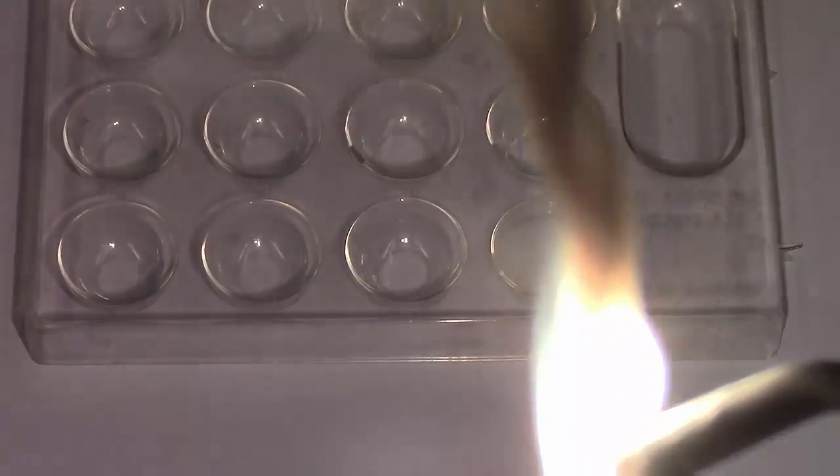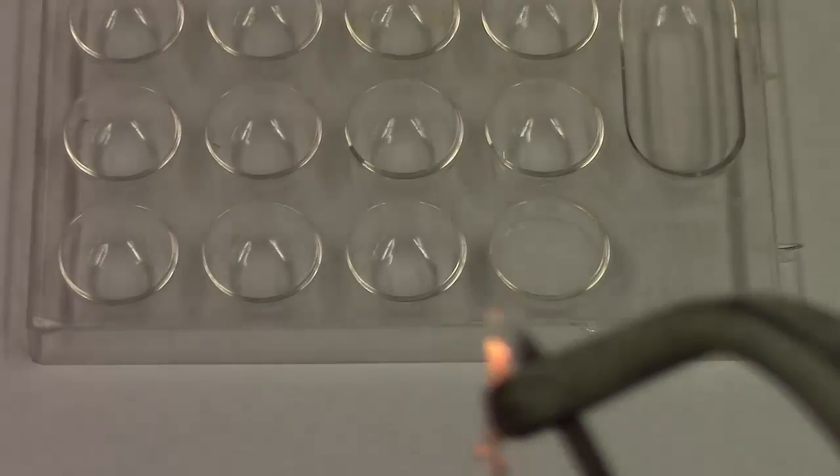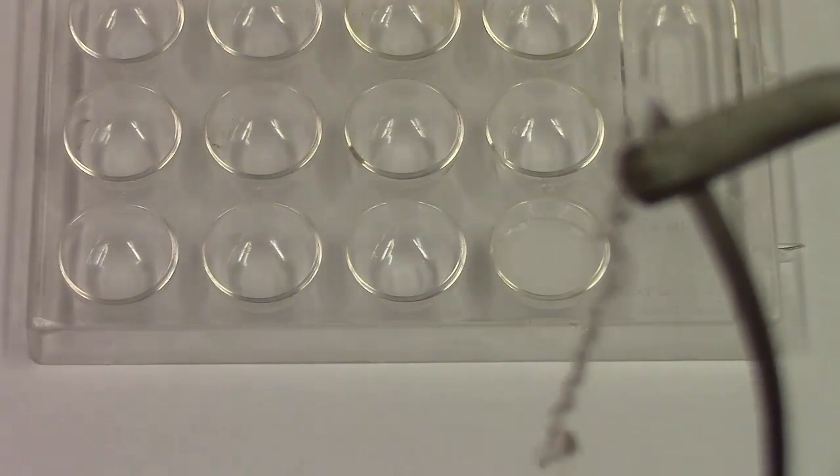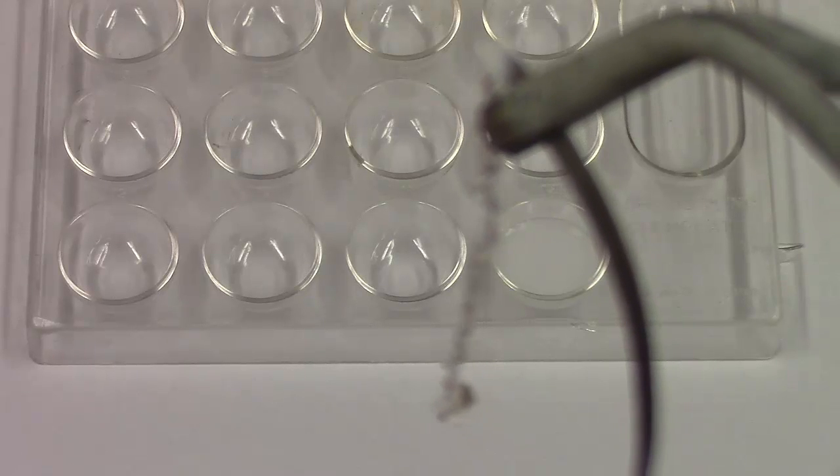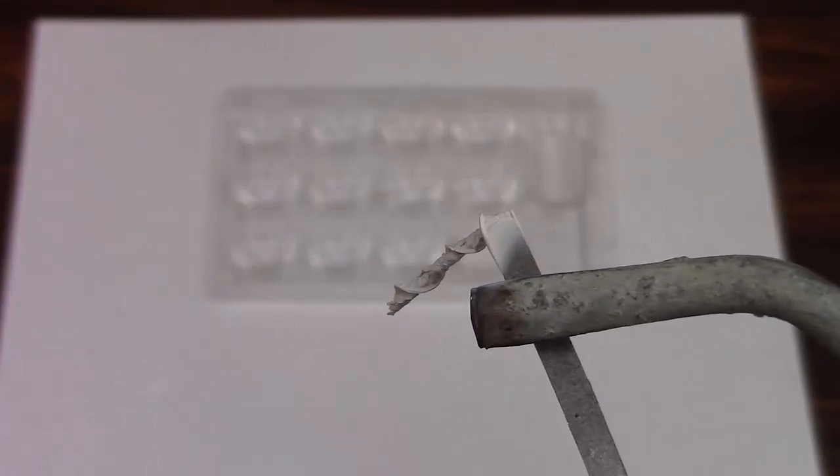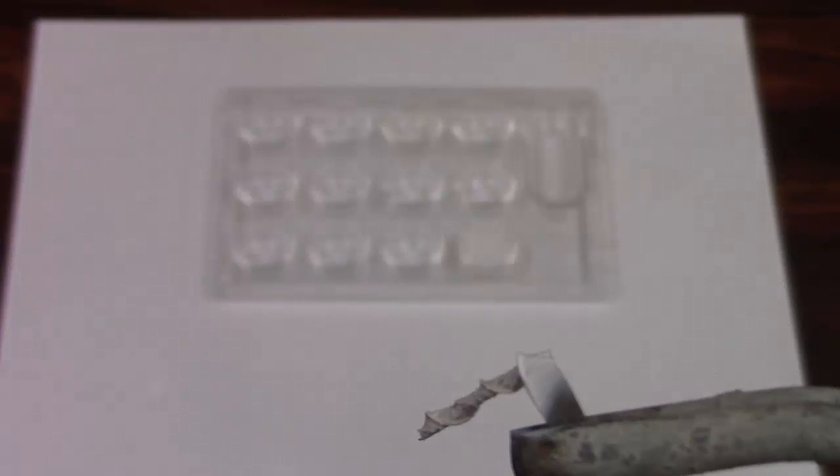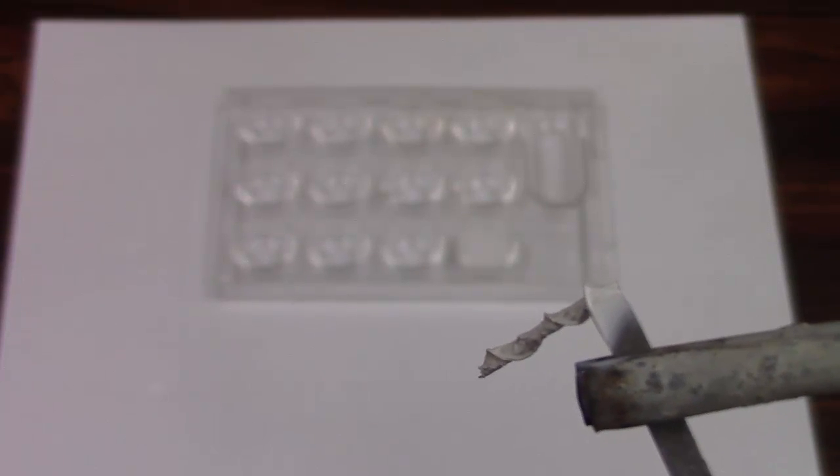There we are burning our magnesium. You can see it produces quite a bit of smoke, and our product is a white powder. You can kind of see our product right here at the end—it's a white solid.